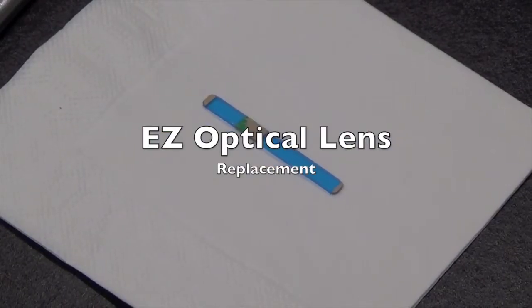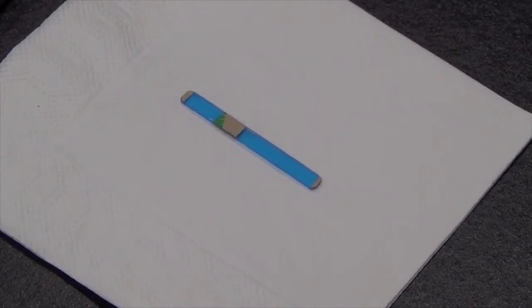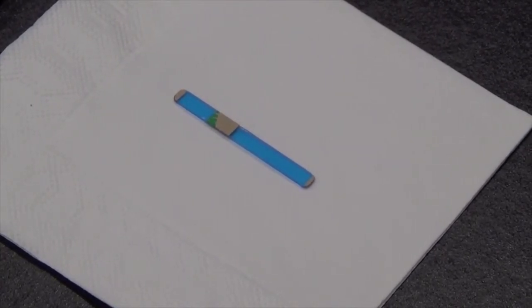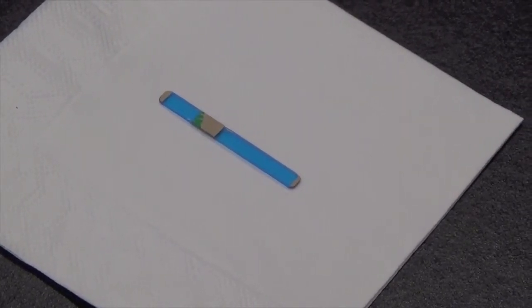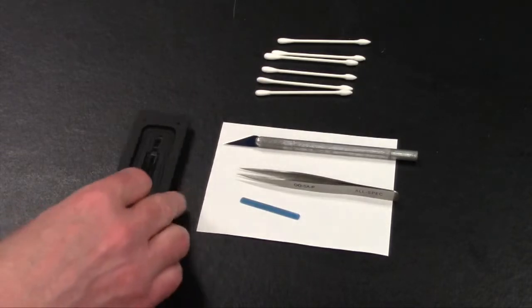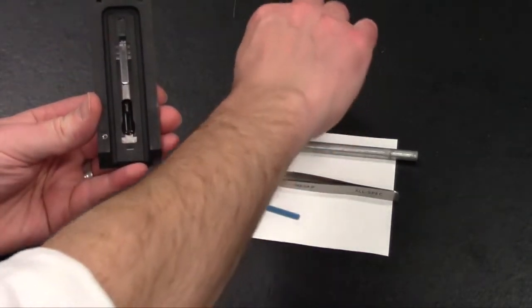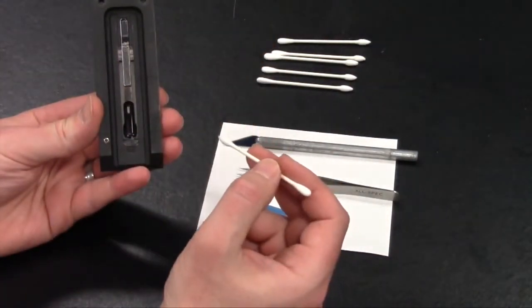The other part of the Easy Reader Cleaning Kit is what we call a removable or replaceable optical window or lens. That's this plastic piece shown here that has the brown label that we're going to peel off and the blue protective coating that will also be peeled off when it's replaced on the Easy Reader slide. This next part of the video will show you, on the bottom half of the Easy slide assembly, if this optical plastic lens or window is scratched or damaged in any way, how to replace it.